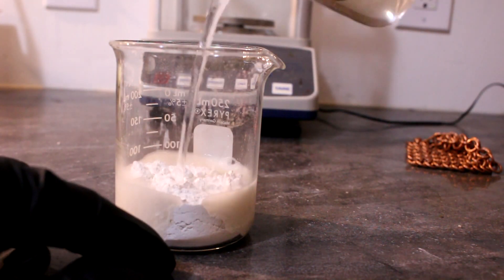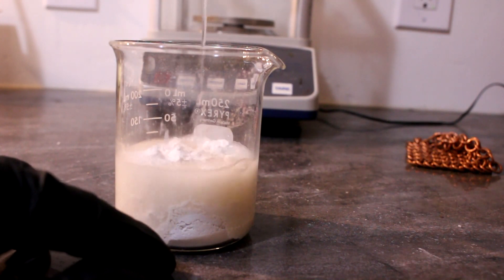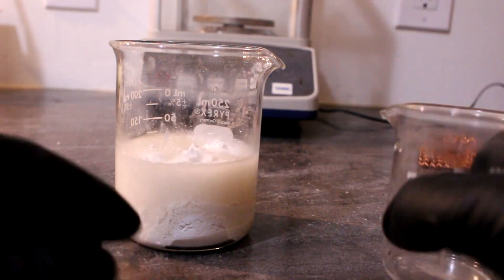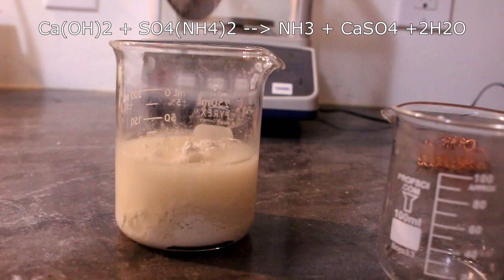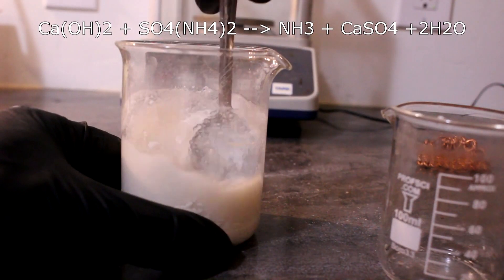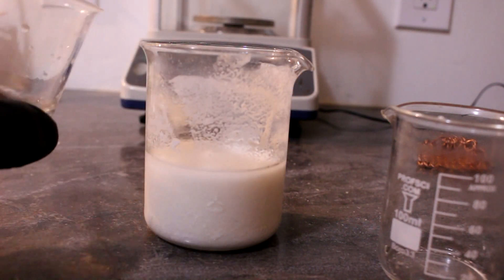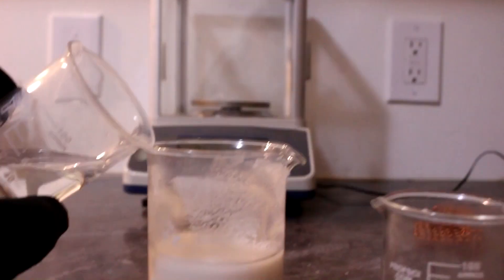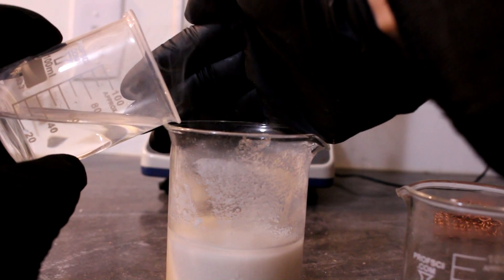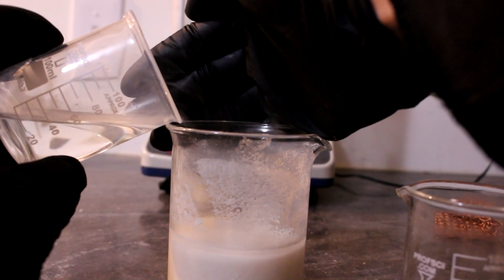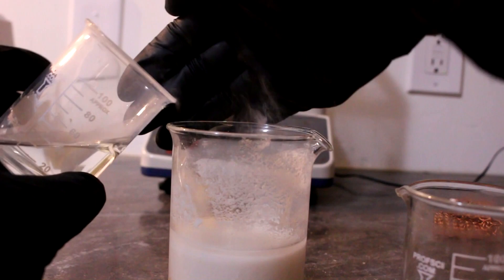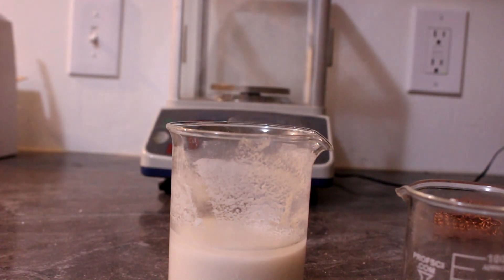This should create ammonia as the calcium forms calcium sulfate which is mostly insoluble. So now we should be able to see lots of ammonium chloride forming with the hydrogen chloride vapor indicating that ammonia has formed.